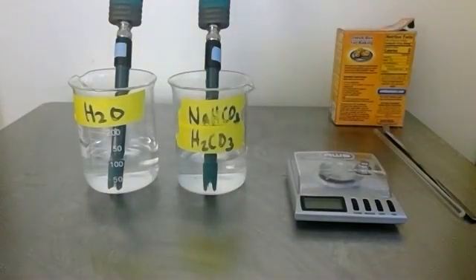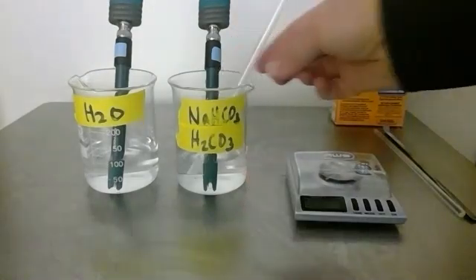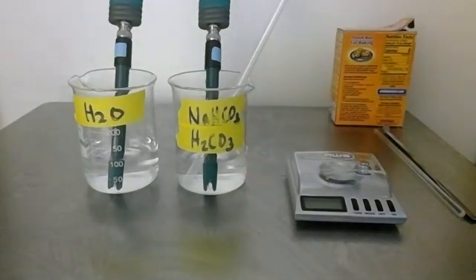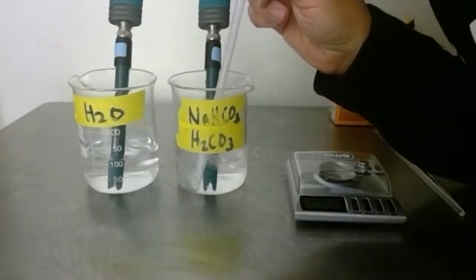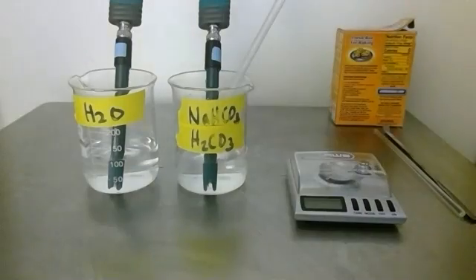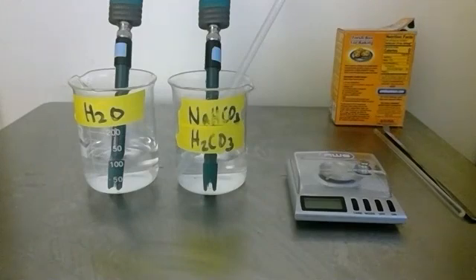Right now it's just water and I need to add sodium bicarbonate and carbonic acid. Carbonic acid needs to be made with CO2, it's not shelf stable, so I'm going to generate carbonic acid by blowing carbon dioxide through a straw into my solution until the pH comes down to below six. I'm going to do that for two to three minutes.